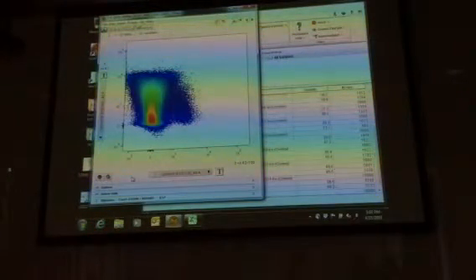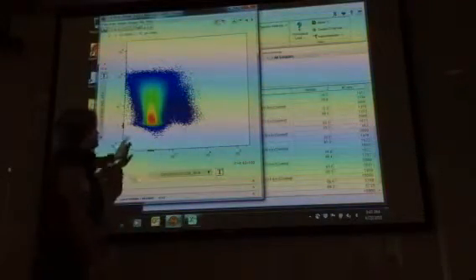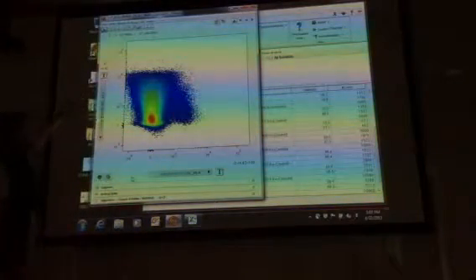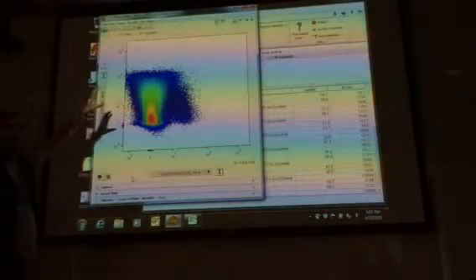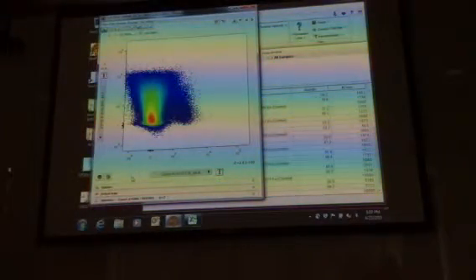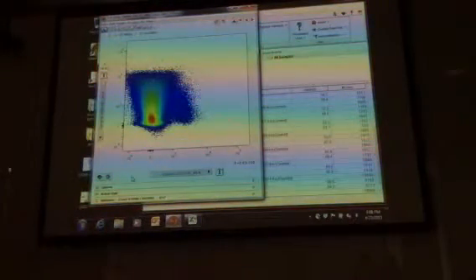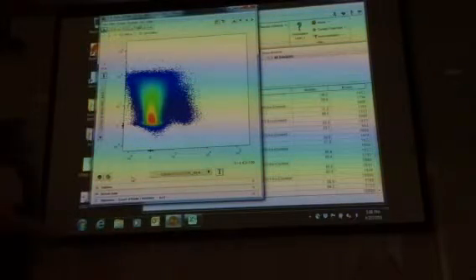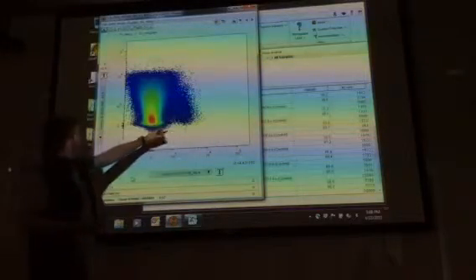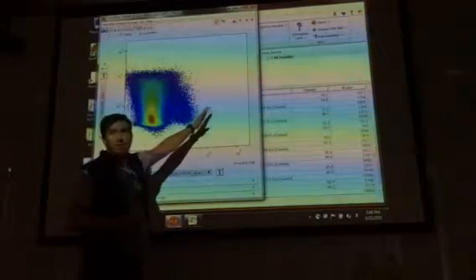With this, here's what we have. This is CD34 on the bottom. This is CD38 up here. The question is now, where do we draw the gates? This is where you need to be able to convince yourself exactly where to draw the gates. Because simply by looking at this plot, you may say, all right, there seems to be a cutoff about here, whereas this represents our CD34 positive cells.